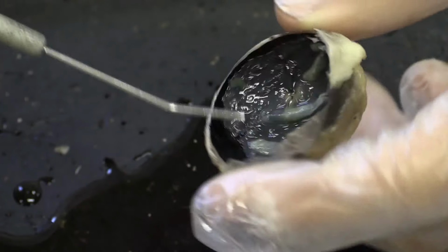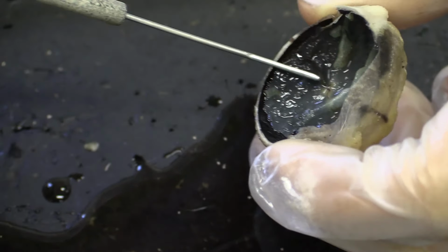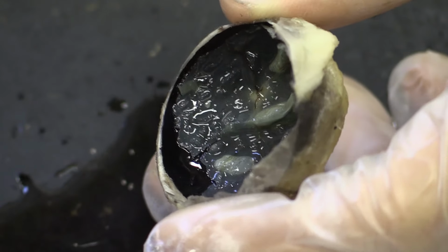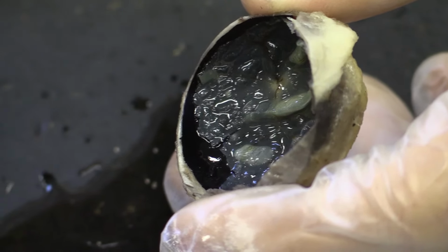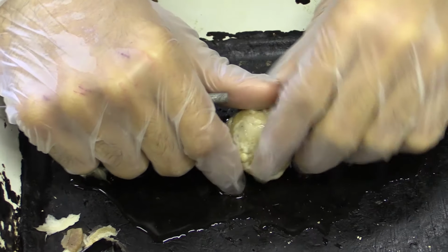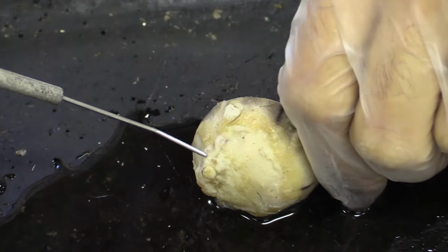And as you can see, all of this comes up to one point. All of this is pushed up against and converges at one point. This little round thing here is the optic disc. And if you look directly posterior of that, when I flip the eye around, you can see we have the aforesaid optic nerve, which I mentioned earlier.